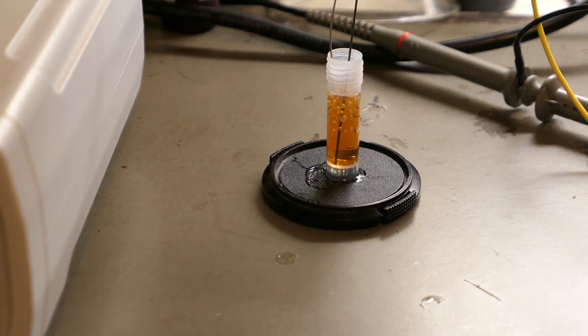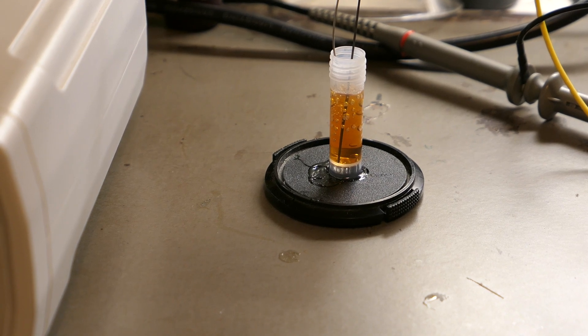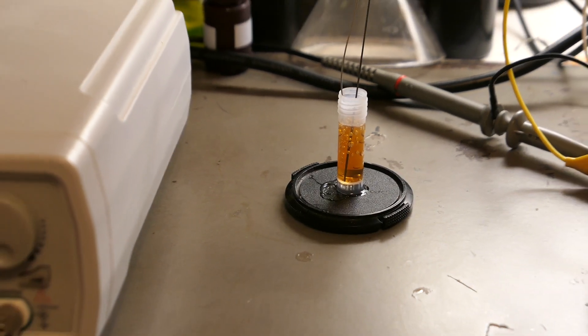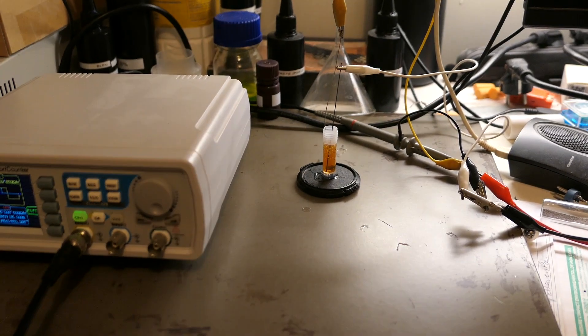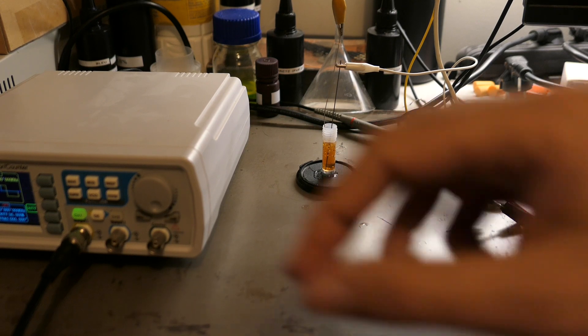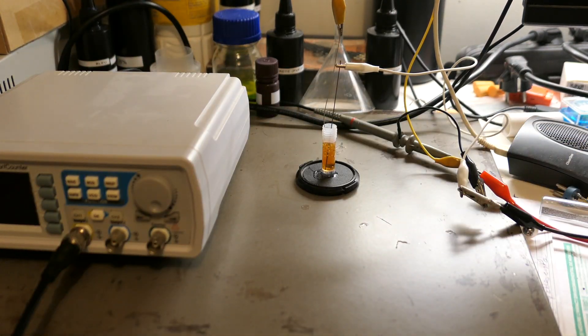Here's the result after leaving the electrolysis running overnight. As you can see, the solution has become more orange. Even though the solution is very colorful, the concentration of hexachloroplatinic acid is still quite low.